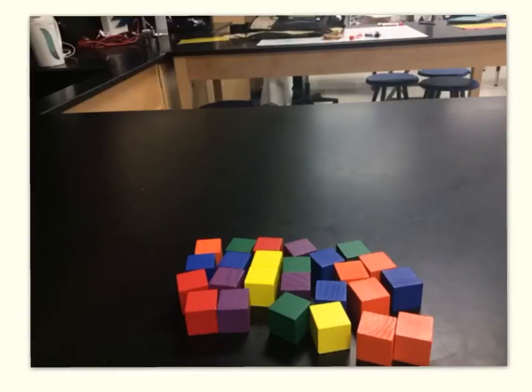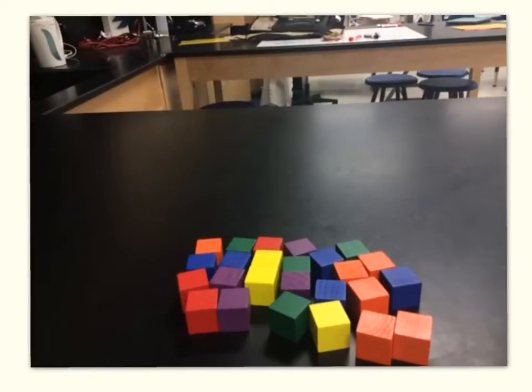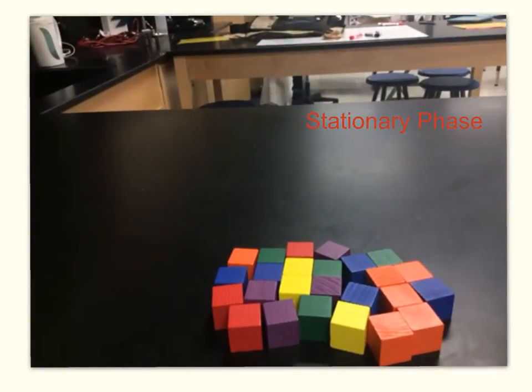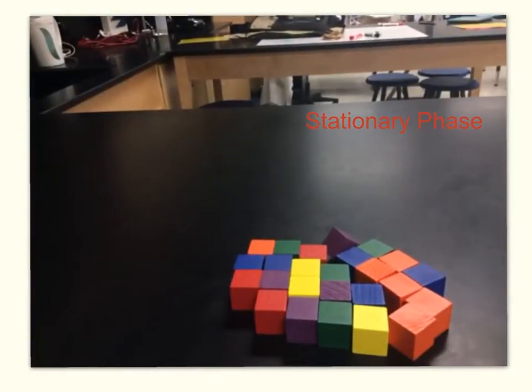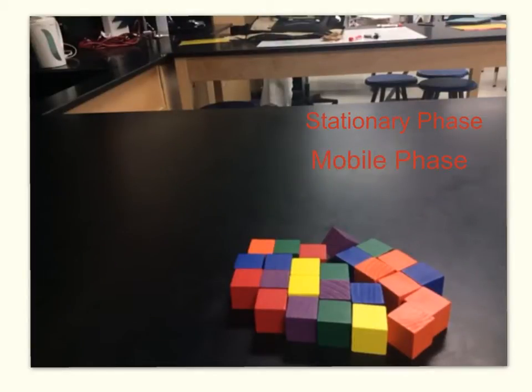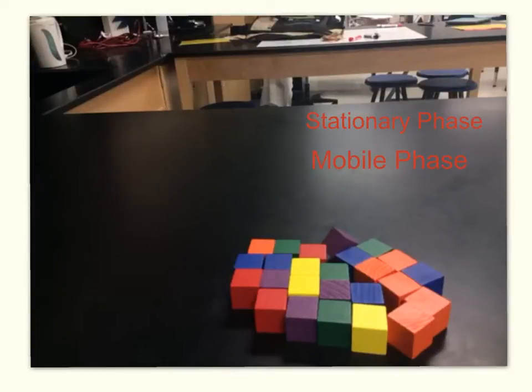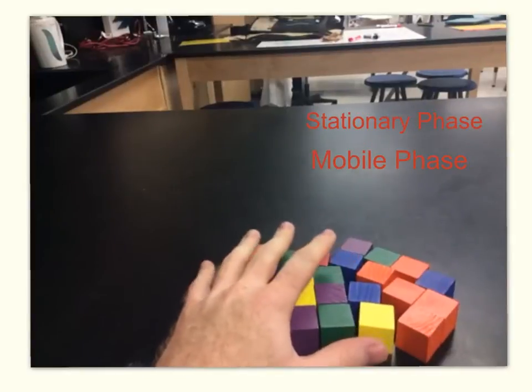All chromatographies — gas chromatography, thin layer chromatography, liquid chromatography, paper chromatography — they all work on the same basic principle. We're going to have some stationary phase, which in this case is going to be a table. The table does not move throughout the experiment, and then we pull our sample through the stationary phase using some mobile phase. Things that have a strong attraction for the mobile phase will get pulled very quickly through the stationary phase — they'll move real fast up our paper. Things with a stronger attraction for the stationary phase will not get pulled as quickly, so we start seeing a separation.